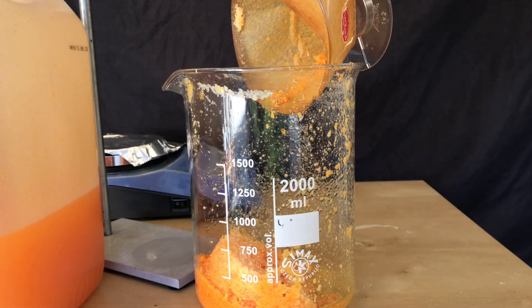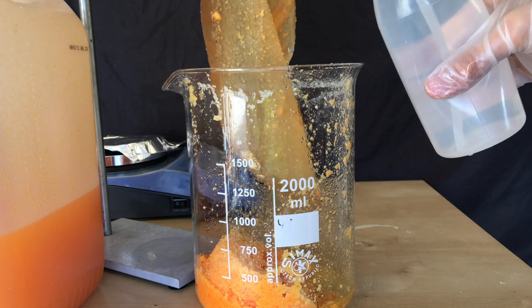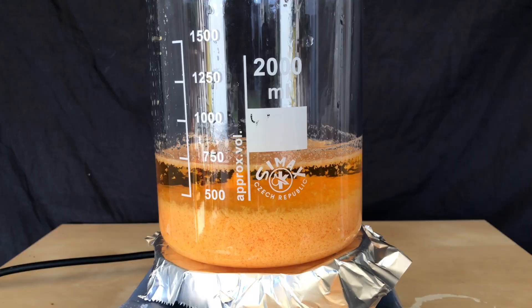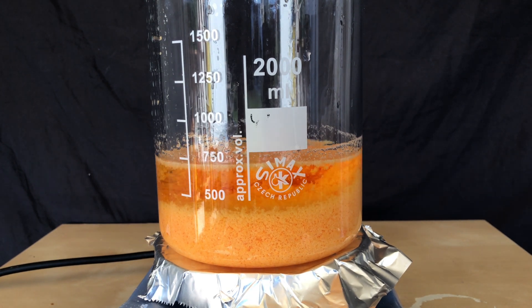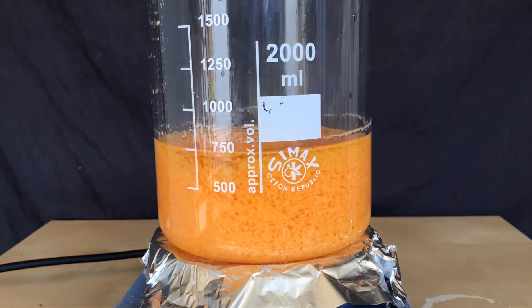As I was not happy with the bromine contamination, I added the wet filter cake to a beaker. As I didn't want to lose any product I even rinsed the filter paper. The hot plate was set to 100 degrees Celsius and stirring was turned on, and I let it heat for about half an hour.